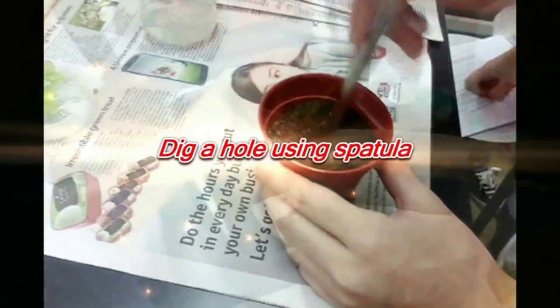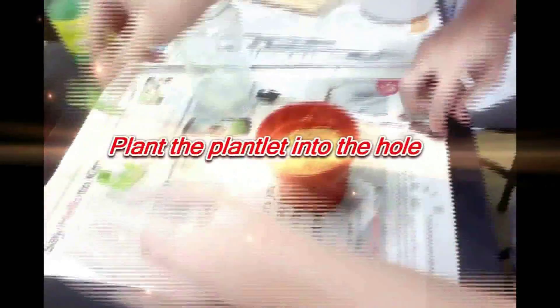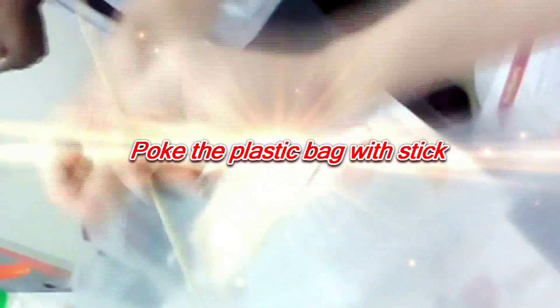Then poke the aluminium foil with a stick and cover the bottom of the pot. Add soil into the pot. Make the soil wet using a water sprayer — remember not to overspray the soil. Thirdly, the plantlets are then transferred to the flower pot containing light soil which has already been wetted with water, and it is placed in a shaded environment. A clear plastic bag is then used to cover the plantlet. Remember to make holes on the plastic bag and spray a little water onto it to create a humid environment for the plantlets.